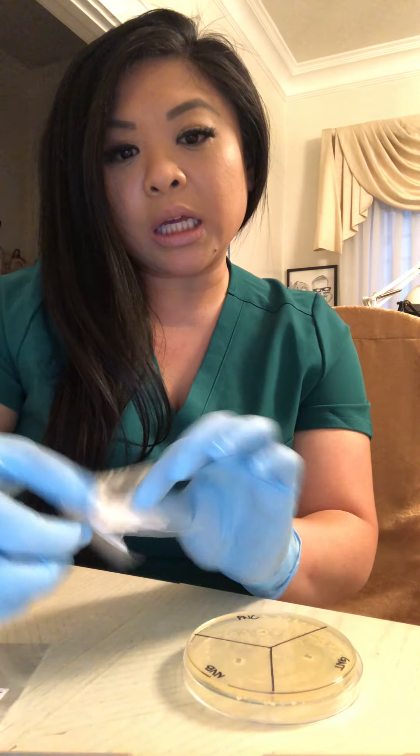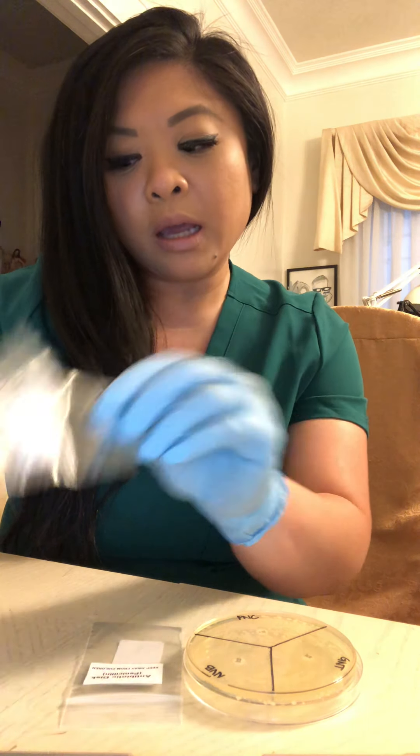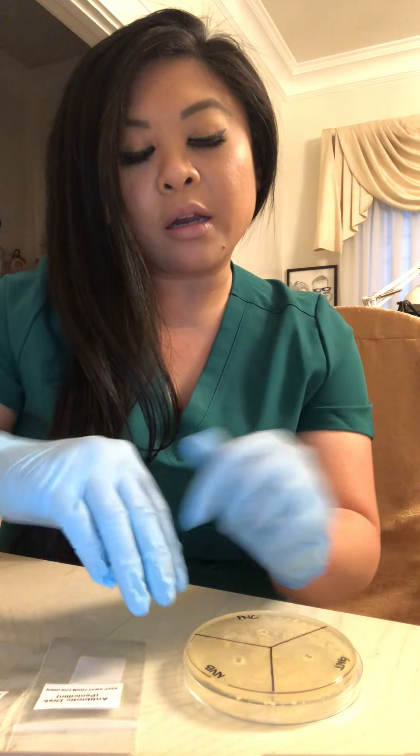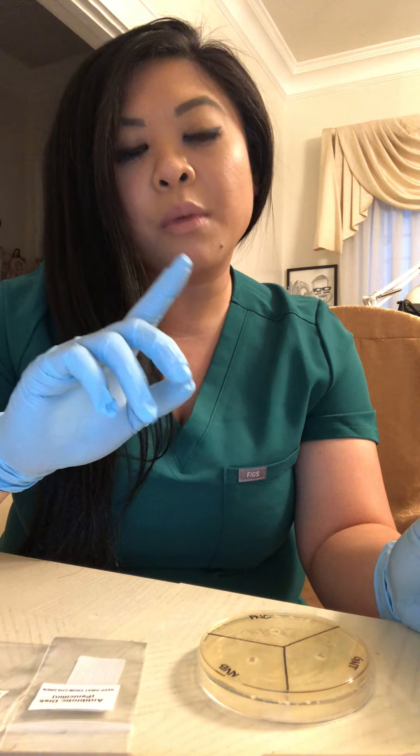For this week, we used penicillin, novobiocin, and gentamicin, which came in our lab kit and have been on our plate since yesterday. Penicillin is a narrow-spectrum, gram-positive antibiotic. It is bactericidal and is the only one out of the three.